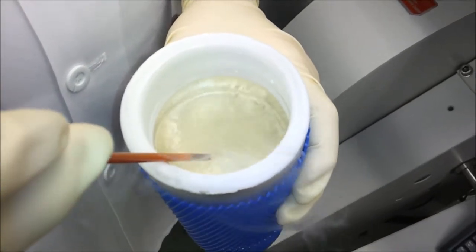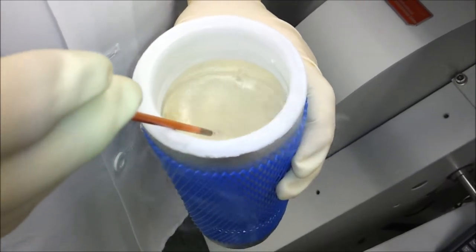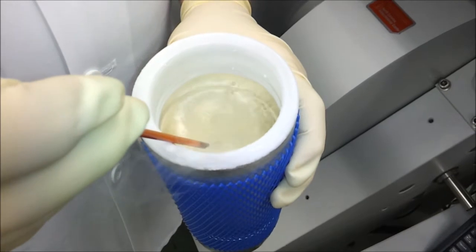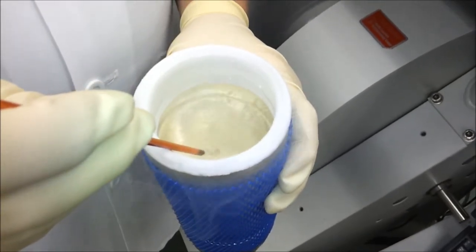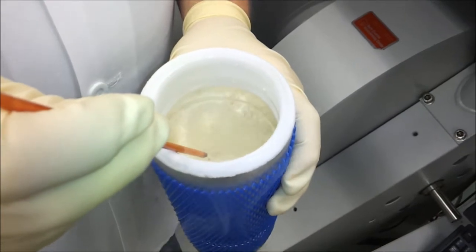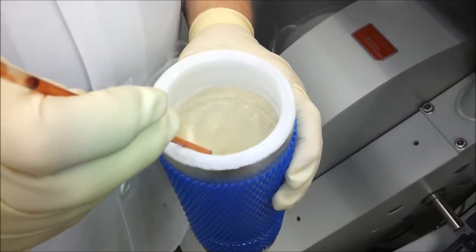If you go too fast, again you'll cause it to expand in the wrong direction and expand too quickly, and that can pop your tube when it hits the air also. So just go at a rate, I usually go say about maybe a millimeter a second, give or take.